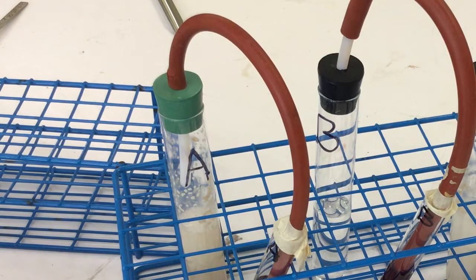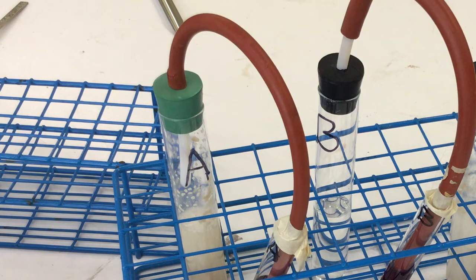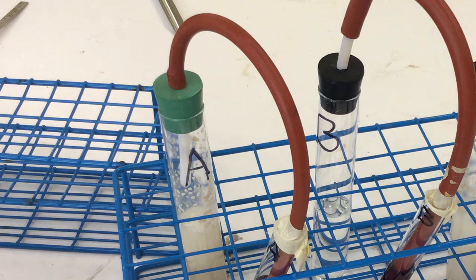Three large boiling tubes, three small test tubes, and three rubber stoppers with attached tubing are seen right here. Remember, the boiling tubes were labeled A, B, and C. To tubes A and B, 25 milliliters of 5% glucose was added. 25 milliliters of distilled water was added to tube C.